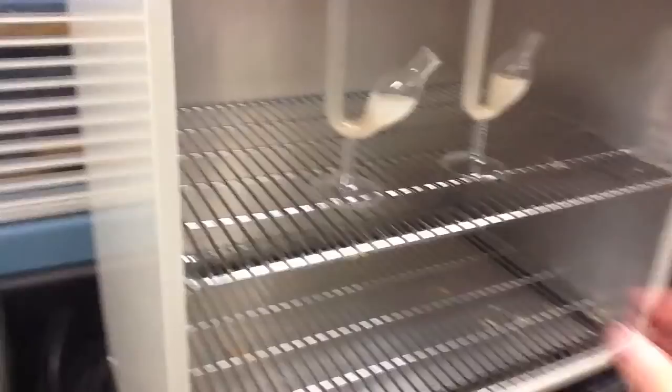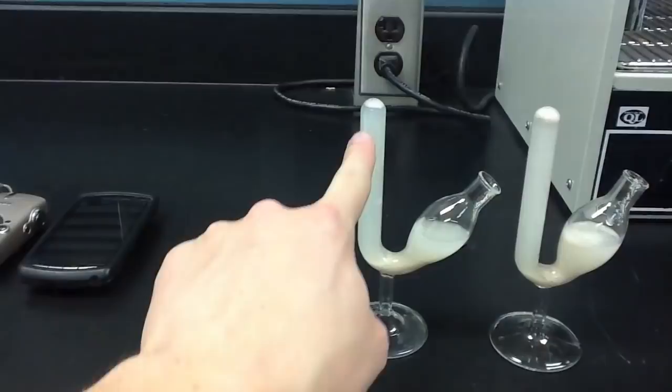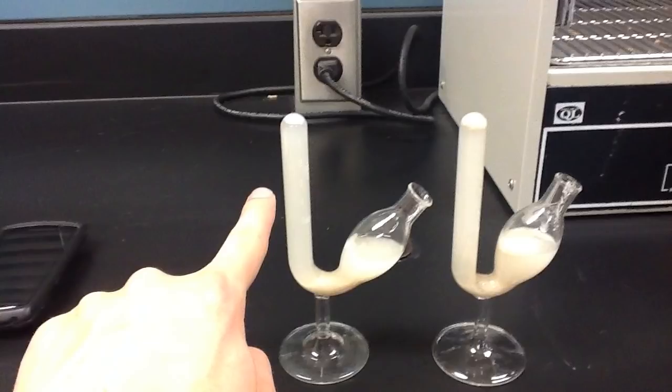The following was observed midway through the experiment, and you can clearly see that at this point in time, both samples appear to be performing some level of fermentation. As can be seen here, it does not appear that the tube on the left has as much fermentation occurring as the tube on the right, because the total amount of carbon dioxide bubbles is less than that of the tube on the right.